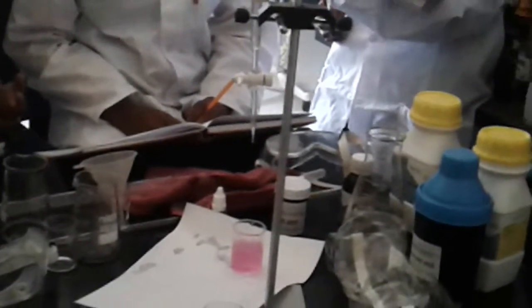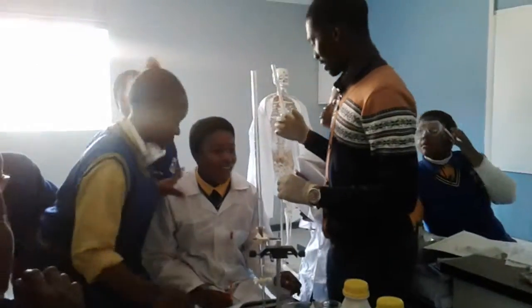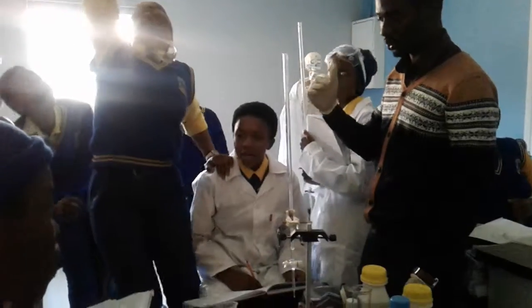Alright, what's the time? 14 past 2. Okay, wonderful. So, put that thing on. Guys, have faith. So, everyone, let me just give you some notes. Everyone sit.